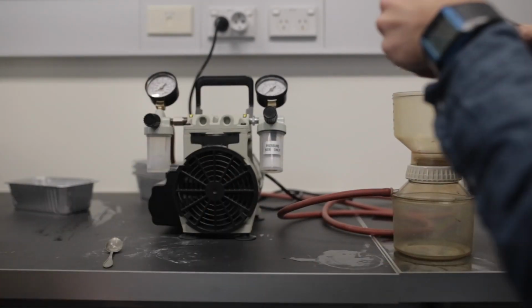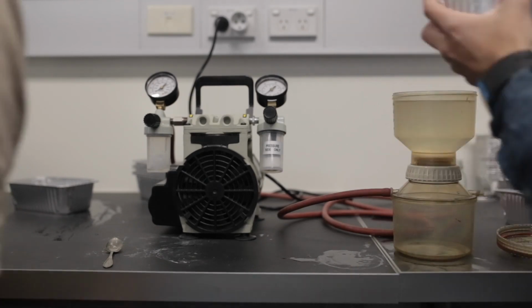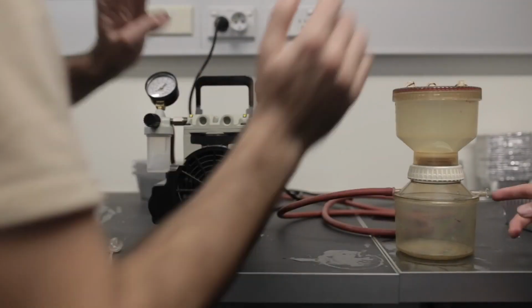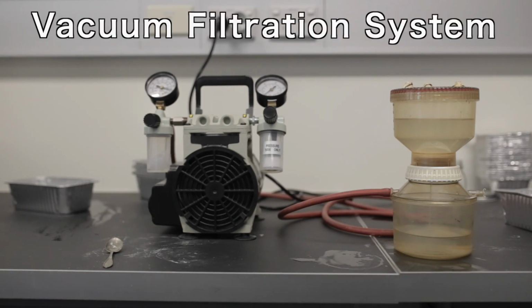The reason for using such a salty solution to mix with the sediment is because the salt water is going to be denser than the microplastics in the sediment will be. This means that the microplastics will float to the top, and when it's poured through a filter, it should, in theory, leave only microplastics on the filter paper.